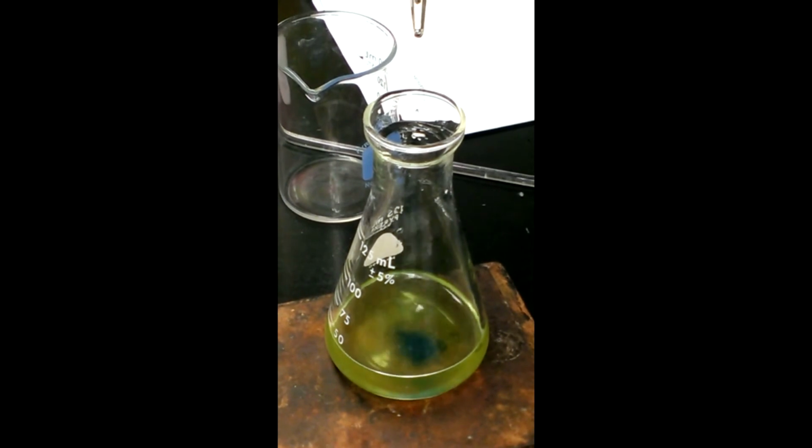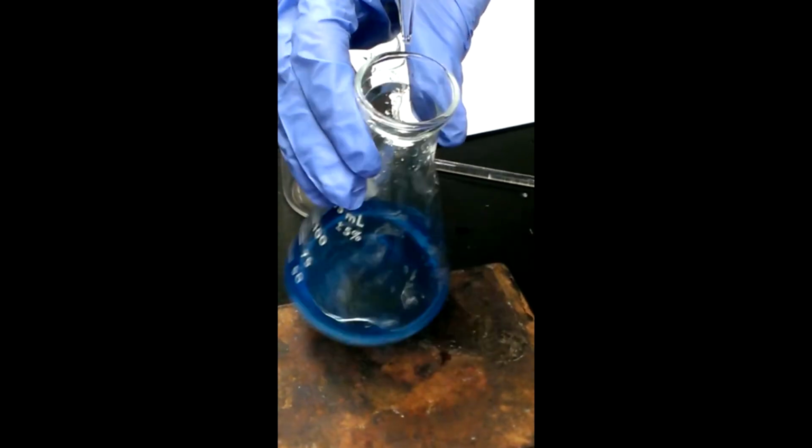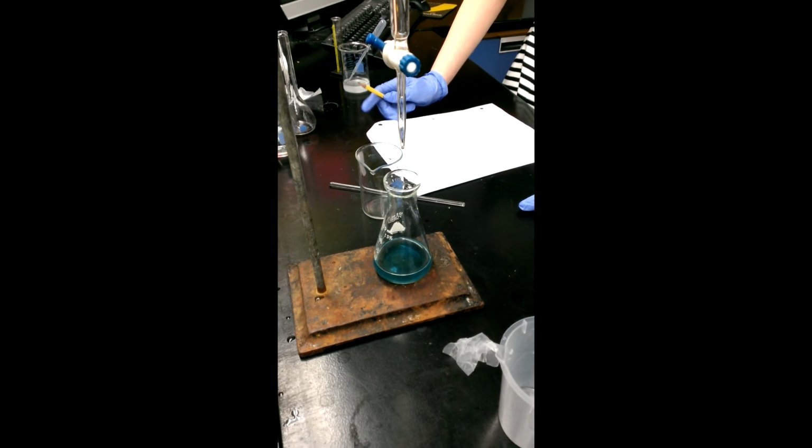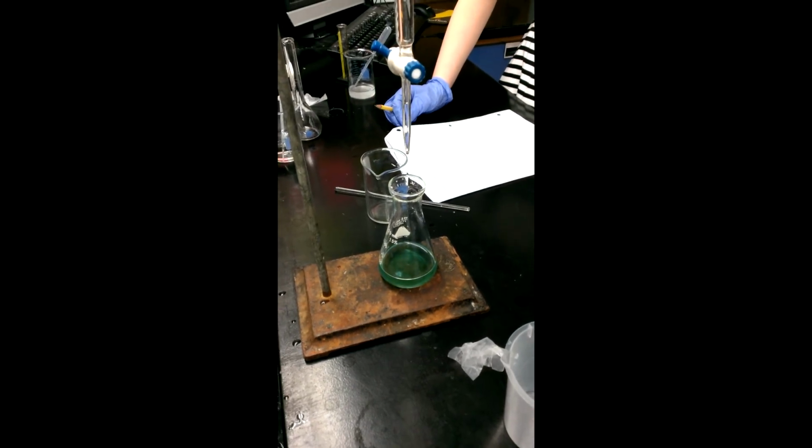And in this example, they put in several drops, and with the several drops, they probably passed their titration point, so they would want to record that as a potential source of error when they're doing the repeats.